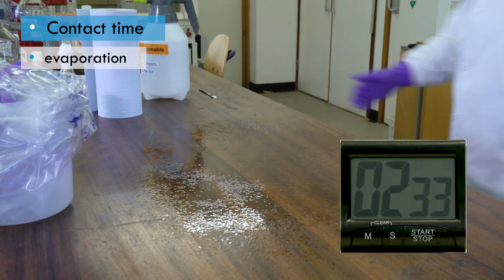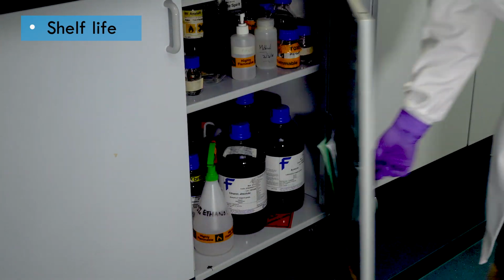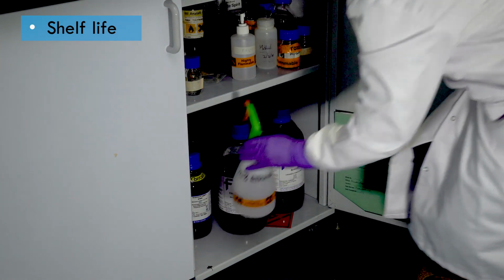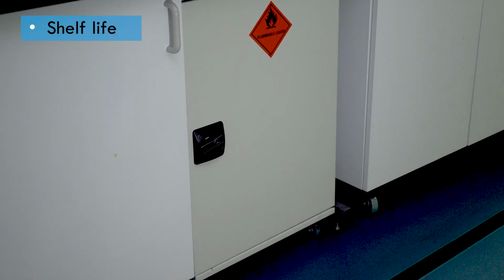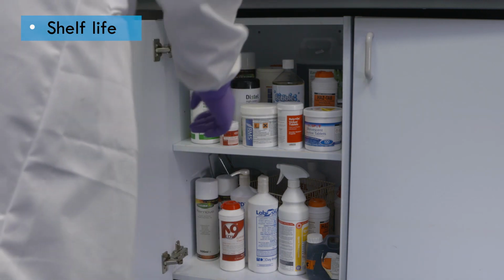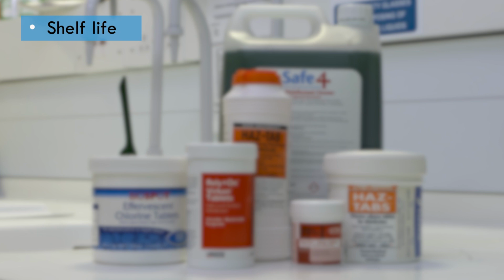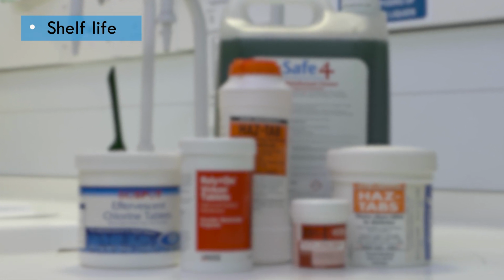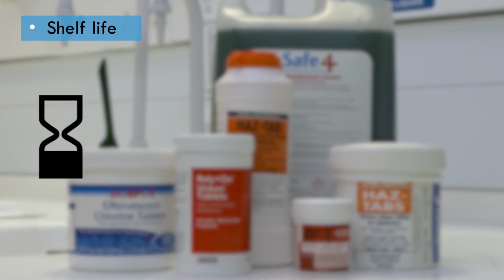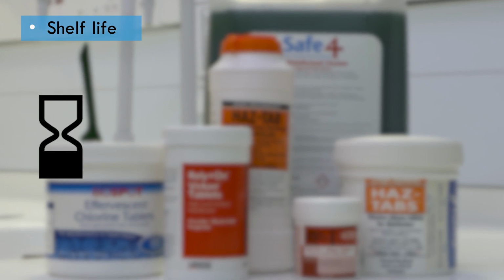The shelf life or expiry date is the length of time the disinfectant product may be stored before the active ingredients begin to break down and the disinfectant will no longer be able to reduce biological agents to a safe level. The shelf life will be noted on the disinfectant container, usually in conjunction with an expiry symbol. Disinfectants must not be used after this date, as they may have become completely ineffective.